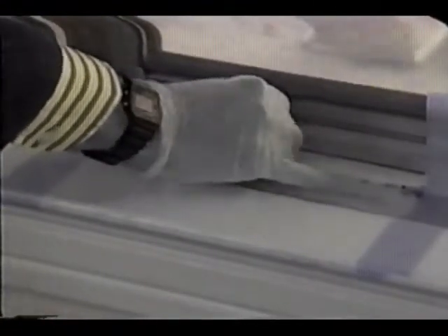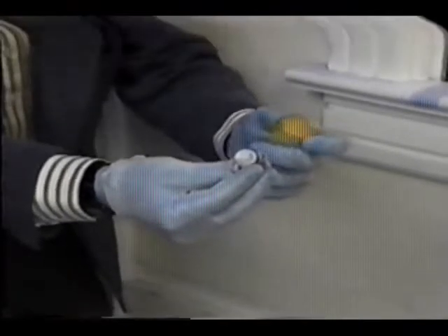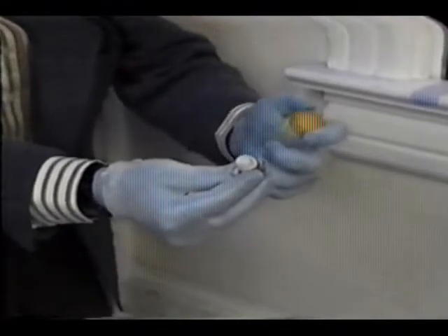In a narrow strip, like a window trough, your second pass will duplicate the first. Wipe the entire surface from side to side with S-like motions if possible. To package the wipe, fold the contaminated side inward once again. Insert the wipe into a centrifuge tube without touching anything else.